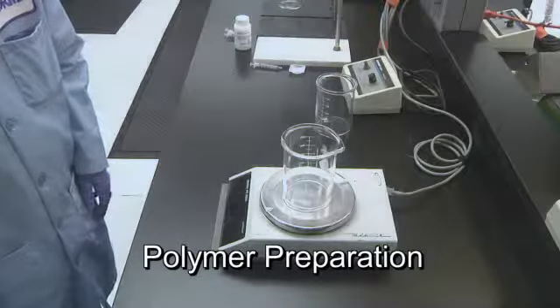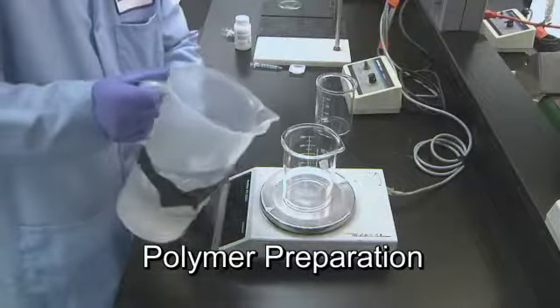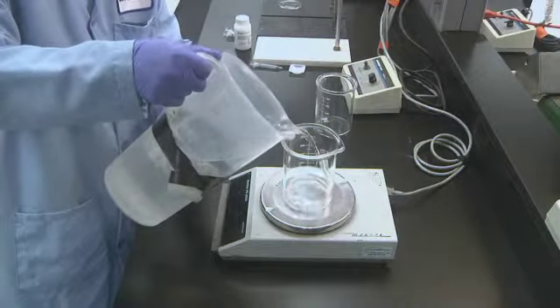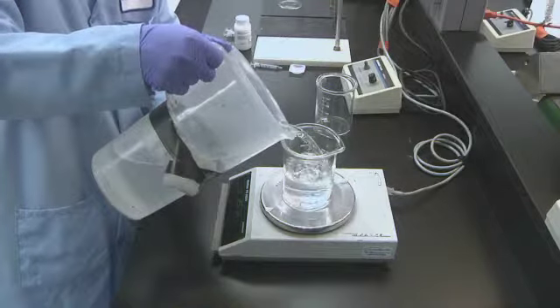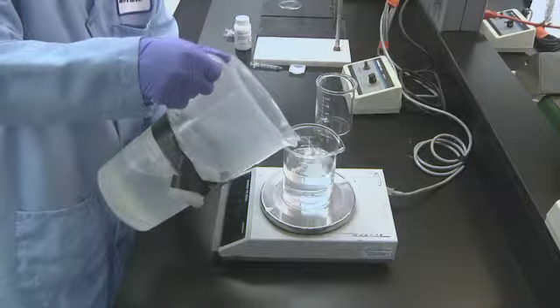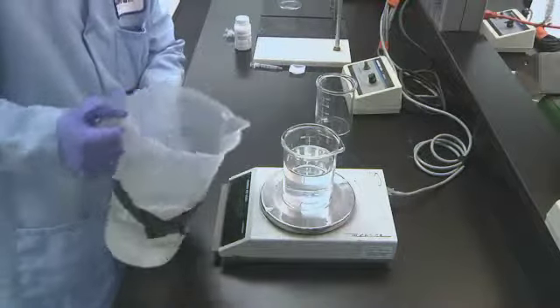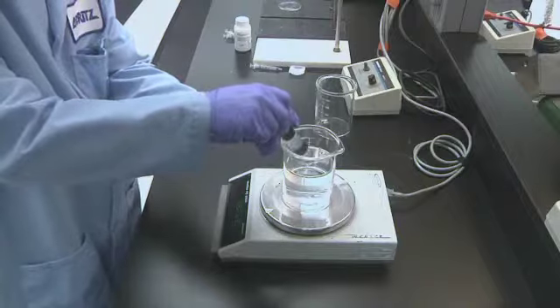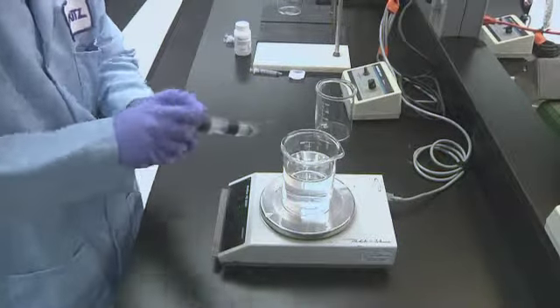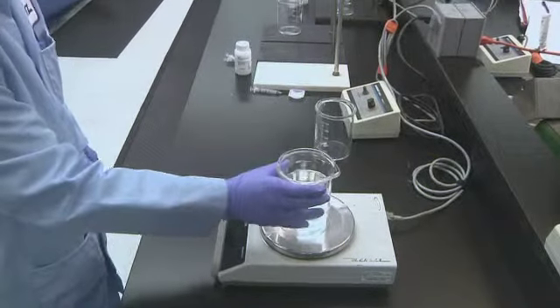Polymers must be diluted with water before using them to chemically condition prior to filtration. Prepare all solutions on the test day.